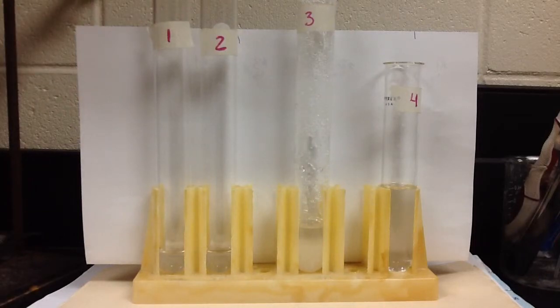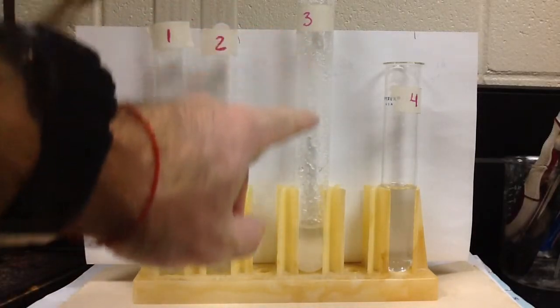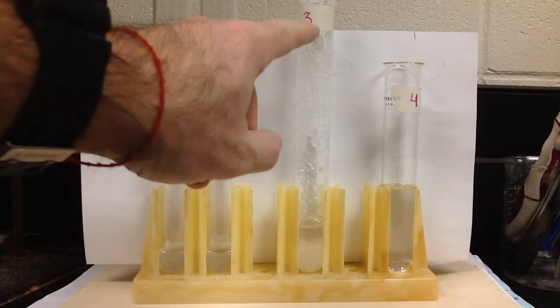So after that, what did we do? Well, we changed one of the factors that can affect the type of solution. We heated it up in a hot water bath. With a rubber policeman, we took all this, kind of pushed this down into the liquid, got all that to dissolve.